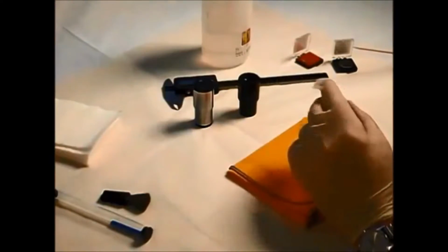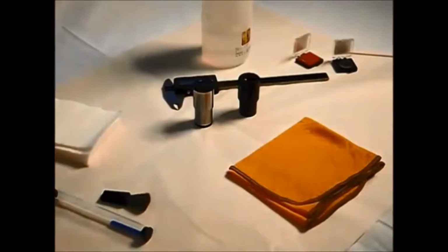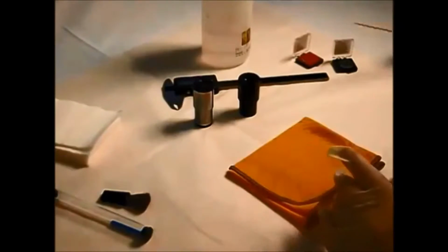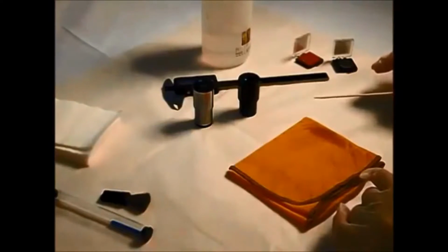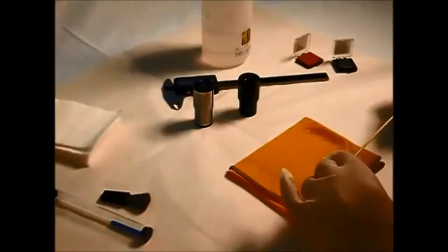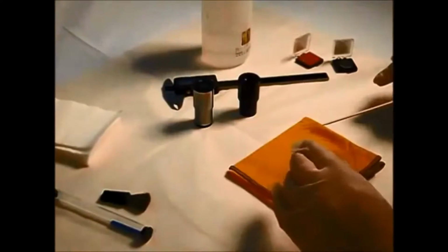Thin human hair is somewhere between 40 and 60 microns, so that's about 3 times as thick. So you can see that it doesn't take a very large particle of dirt or fibre to spoil the view. From experience, repeatedly removing and cleaning and refitting the reticule to complete a dust-free fitting can be very frustrating. So a few basic tools and preparation is a worthwhile investment.